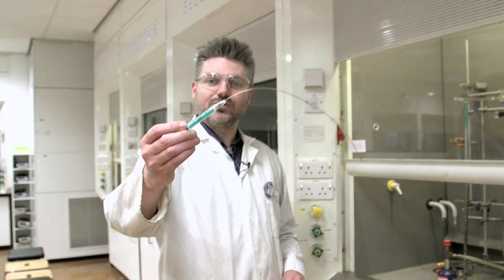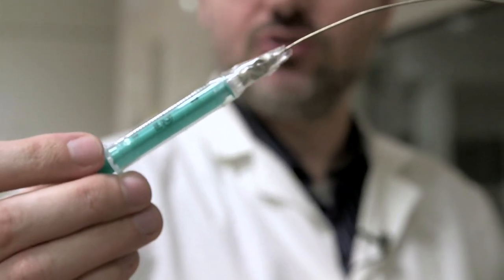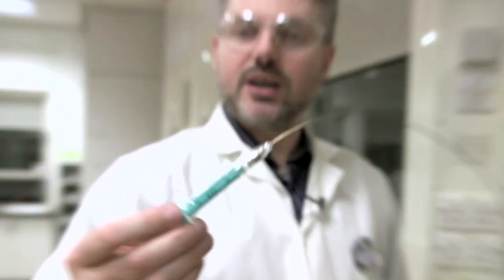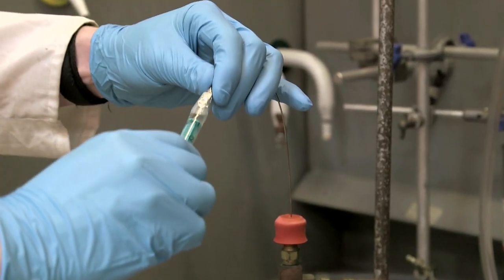So today we're going to try this with this syringe. Now this syringe is made out of plastic, and the idea is that there shouldn't be any contamination from this in the flame. Together with some of the new very high-speed cameras that we've got access to, we're hoping we can get a glimpse of this blue flash in the flame.